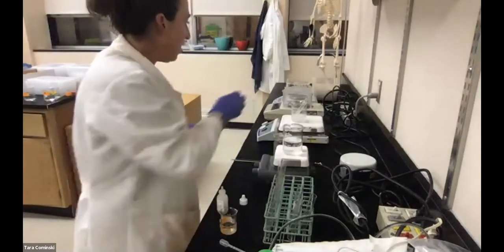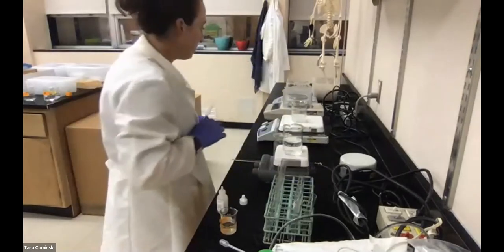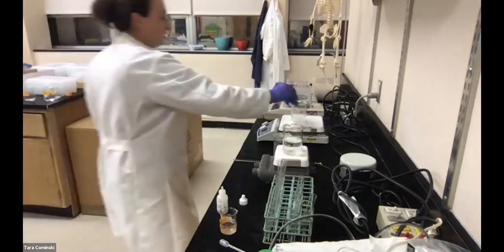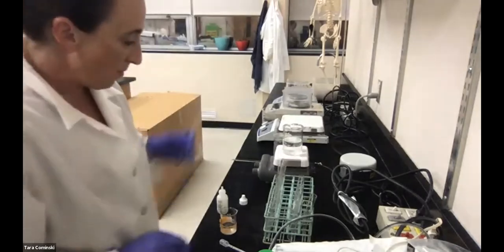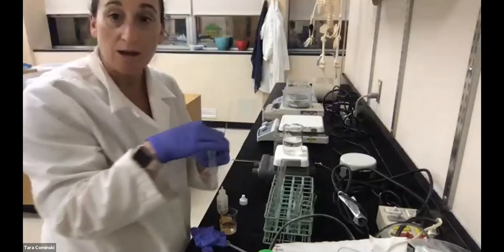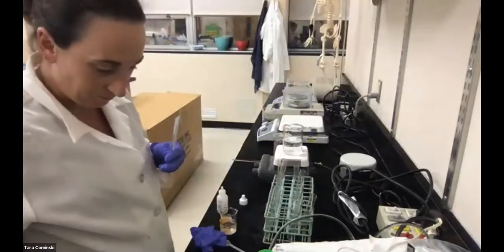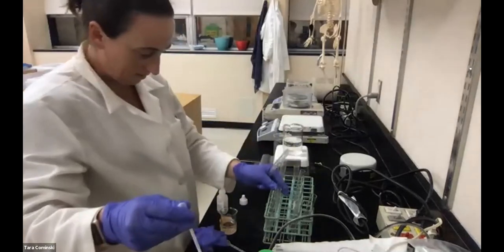Now, that's super hot. Now we go to the boiling one, and again, let me take this off. One second here. Again, I don't want anything to burn down. Okay, so now this is the boiling one here. I'm going to do the same thing. I'm going to keep it in the rack because it's hot, and add the peroxide to it.